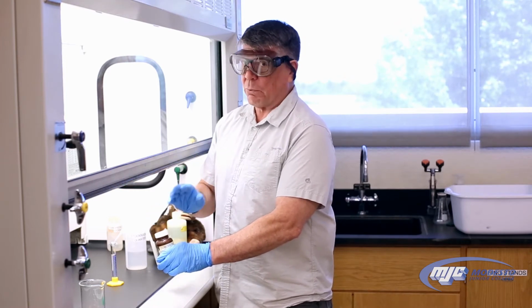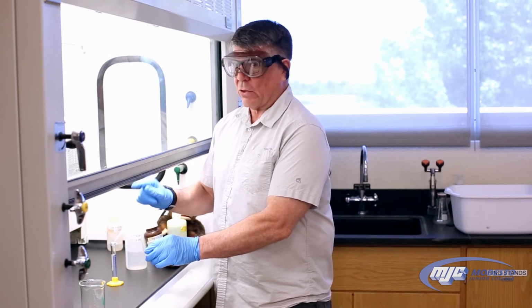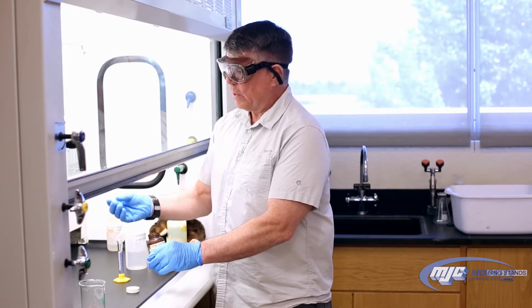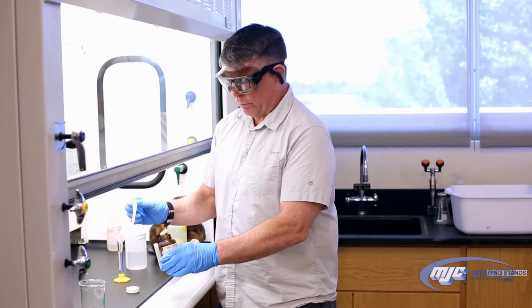Remember, it's extremely important that you do this reaction in the hood and not take this out of the hood until you've added the DI water, which is next. So to measure out the 5 mLs of the concentrated nitric acid, I'm just going to use this transfer pipette. It has marks. I'm going to take 3 mLs and 2 mLs.